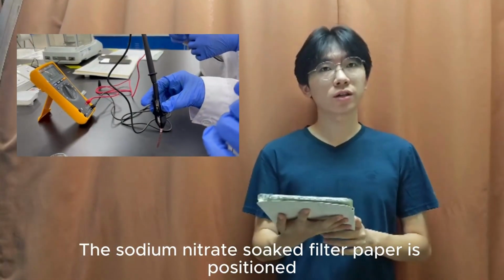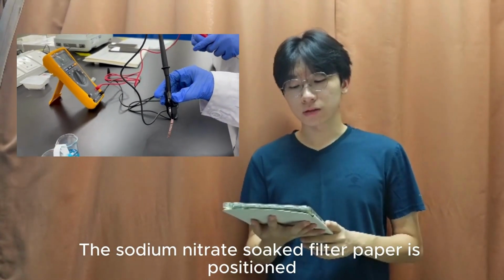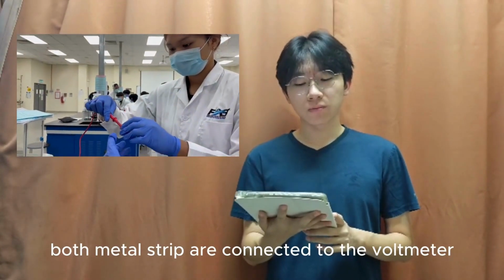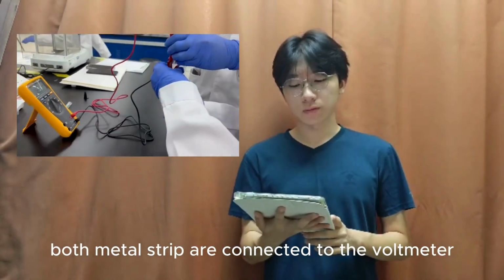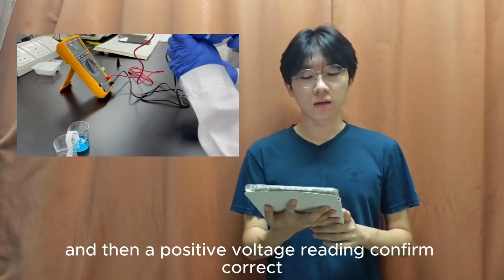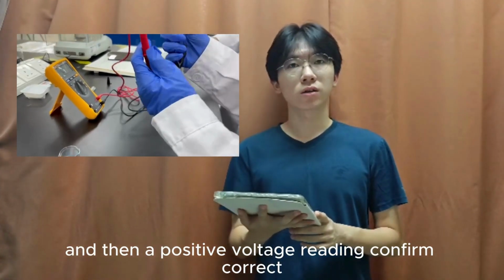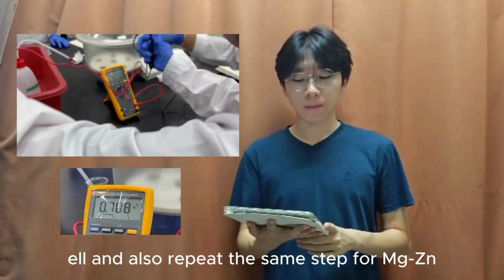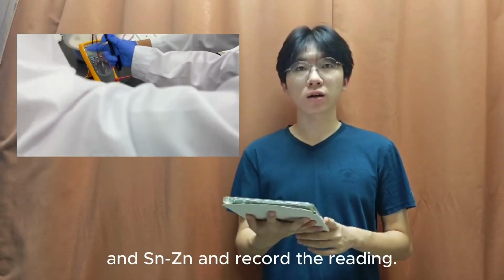The sodium nitrate soaked filter paper is in position, so it dips in both beakers as a salt bridge. After that, both the strips are connected to the voltmeter using crocodile clips, and then a positive voltage reading confirms correct connections. So we record the cell voltage for the Zn-Cu cell and also repeat the same steps for Mg-Zn and Sn-Zn and record the readings.